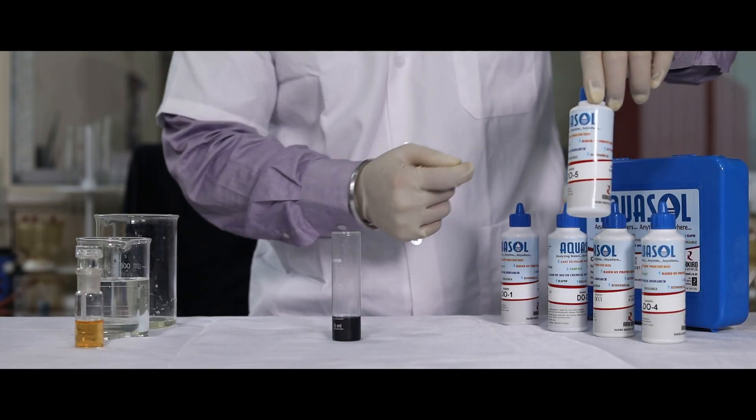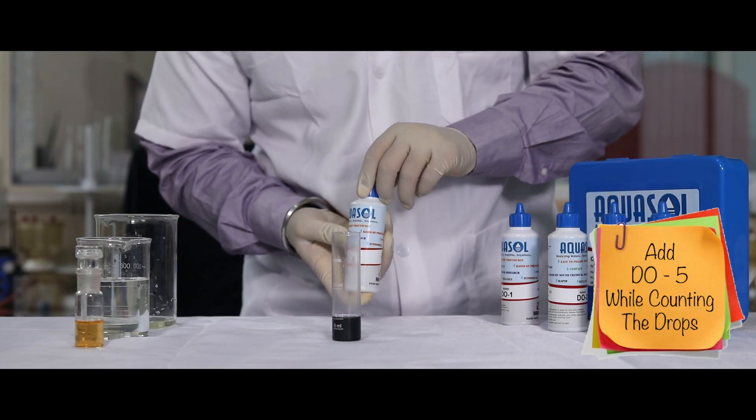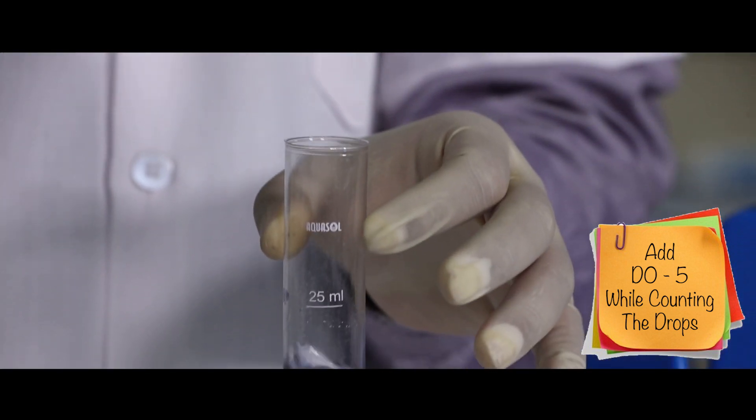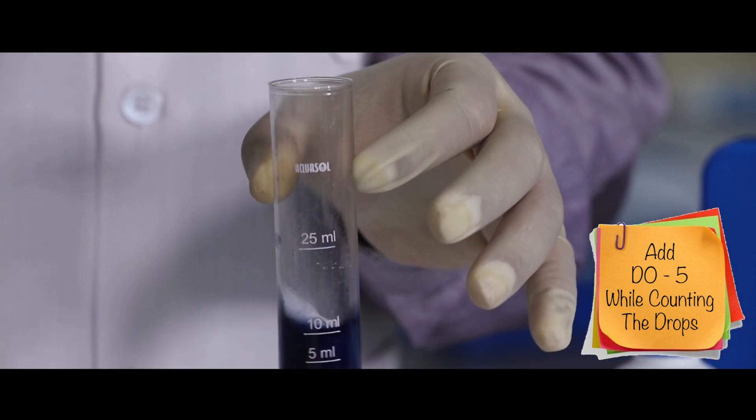Now we will add DO5 reagent drop wise, counting the number of drops while mixing until the blue color disappears.